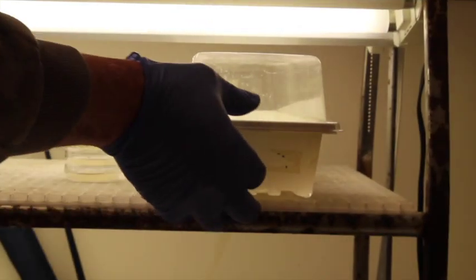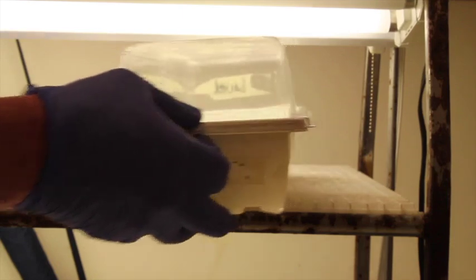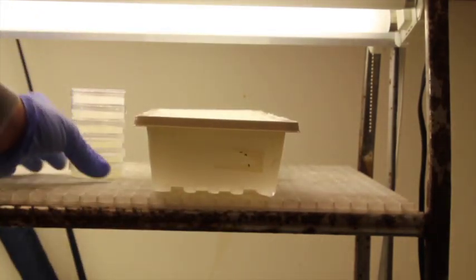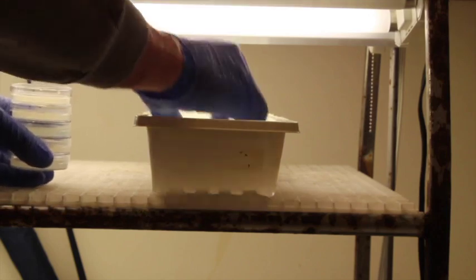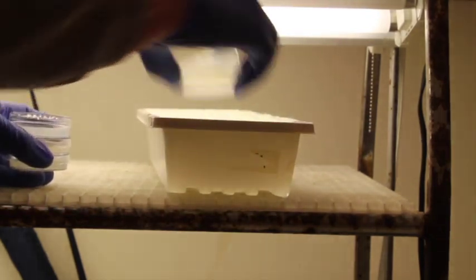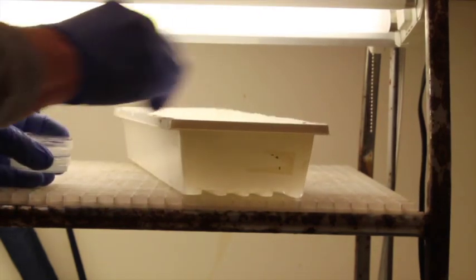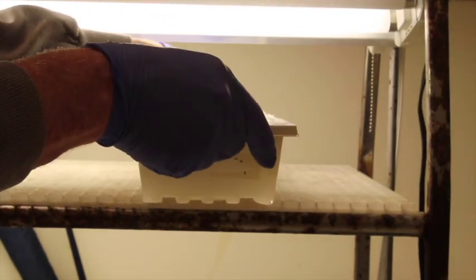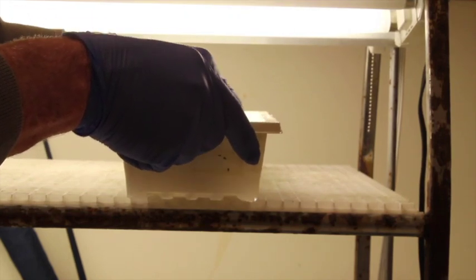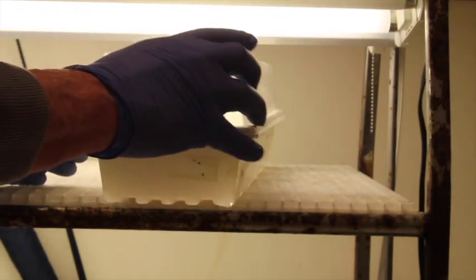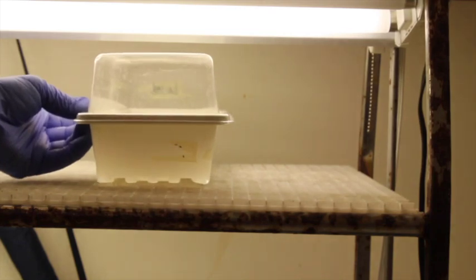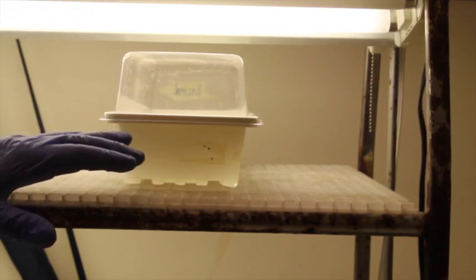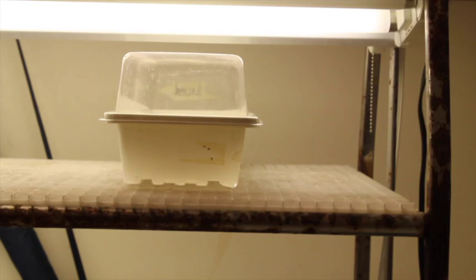The final preparatory step is basically to put the spores in light so that the light can shine down on them and give them the right growth conditions. So I'm basically going to take the plates that we inoculated, place them all into this container. Throw on the lid. And then we'll keep them under the lights for two weeks. These containers are really nice. The height of these are designed so that the temperature in here is the right temperature. So that they incubate and grow at their maximum rate.